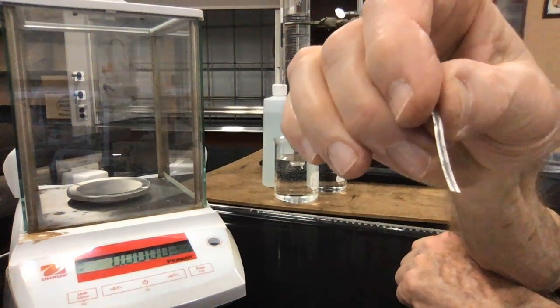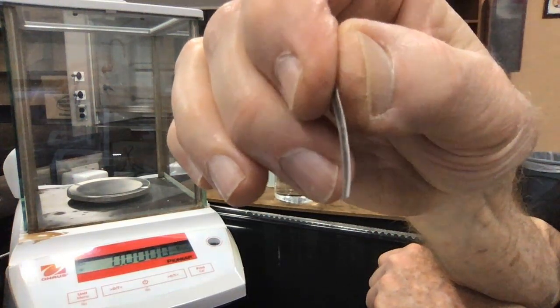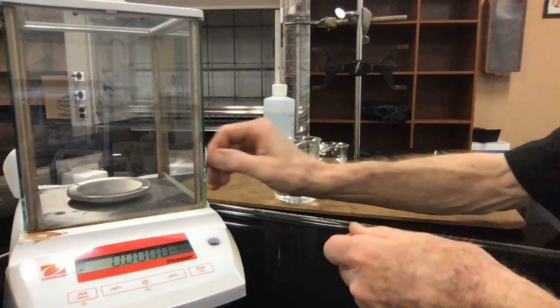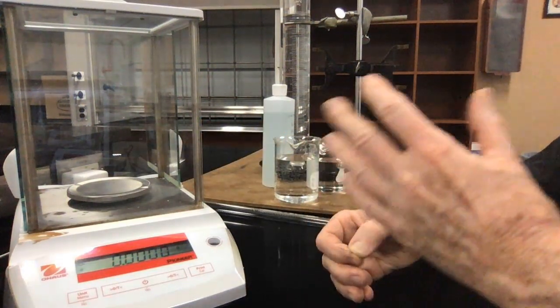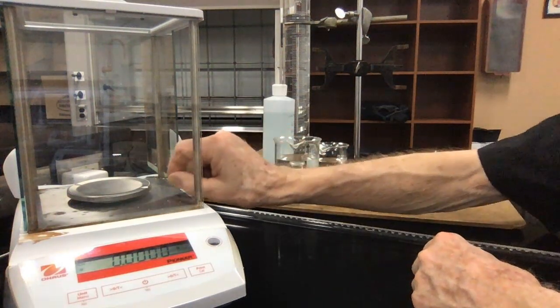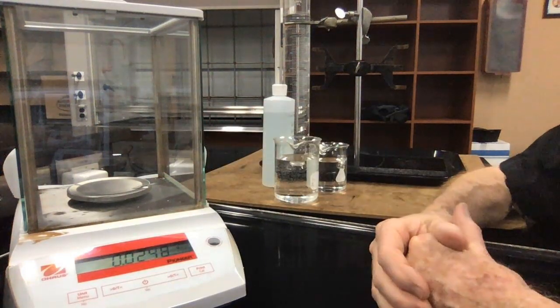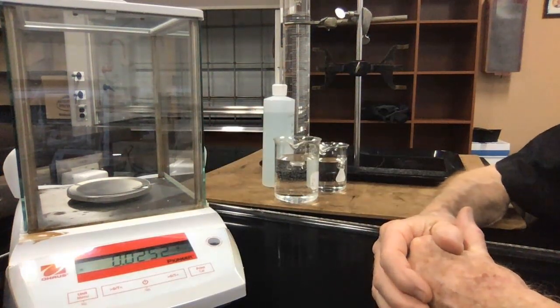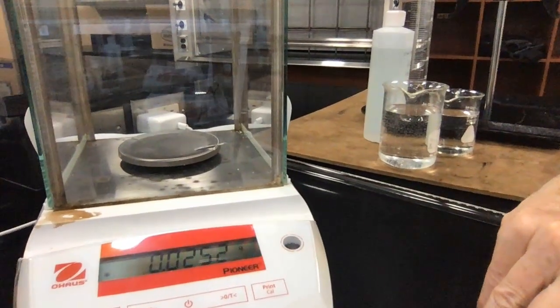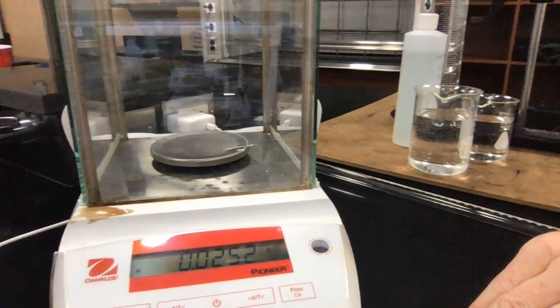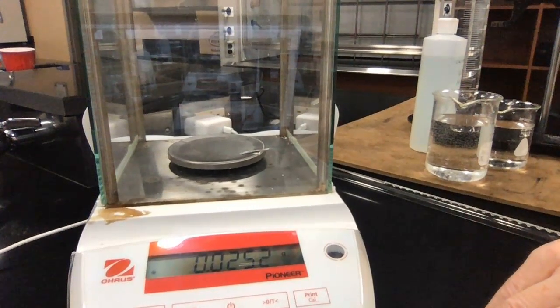It's very thin metal, very light, a little bit silvery, as you can see, extremely thin. So what I want to do is I want to put that into the analytical balance. The analytical balance pan is surrounded by a glass enclosure, and that enables us to measure things without the interference of a draft of air. And then what I do is I look at the display here, and I'm reading 0.0252 grams. So I'll use that number as my starting mass of magnesium.